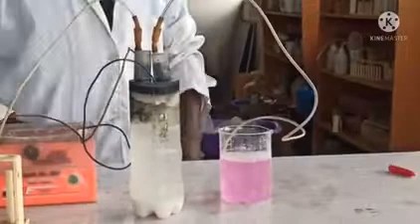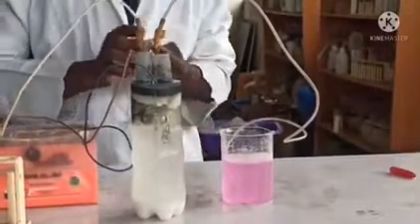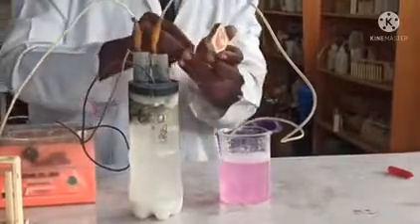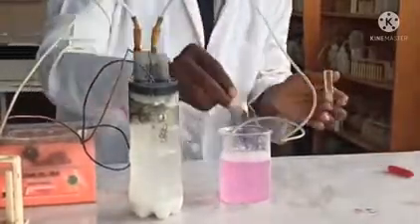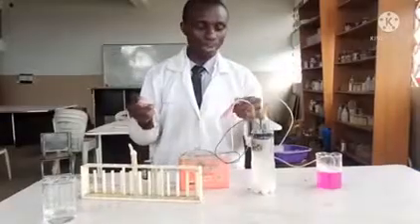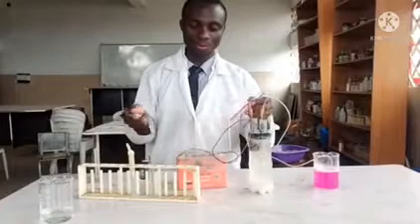So I'm going to test for the hydrogen. Let's see the results once more — you can hear the pop sound showing the presence of hydrogen. We can also observe the decolorization process.